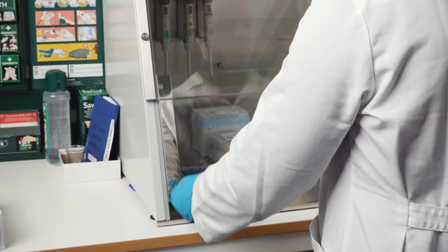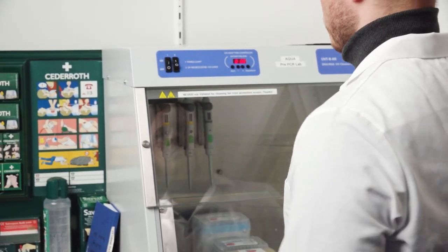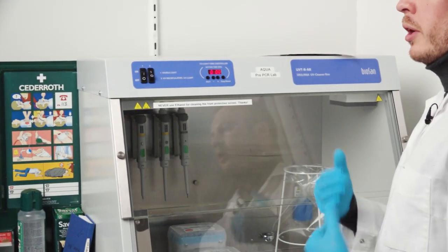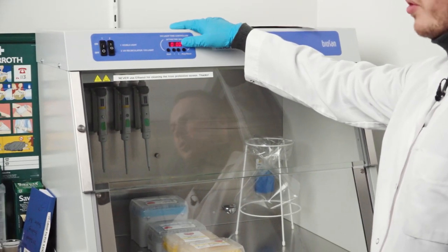Then we take the door, slide it down, then we turn on the switch number two and we will hear a sound of the machine starting and also the numbers here will turn red.